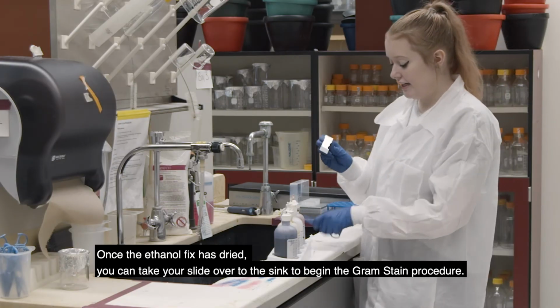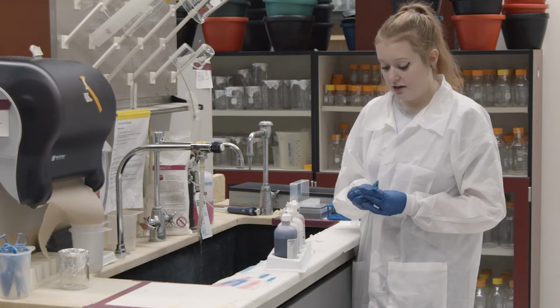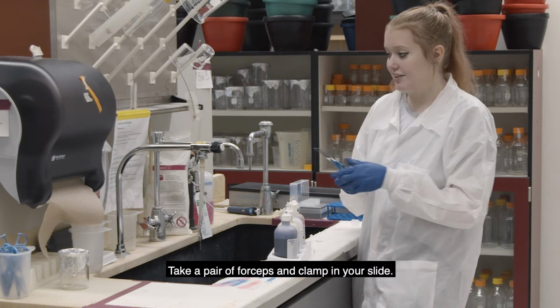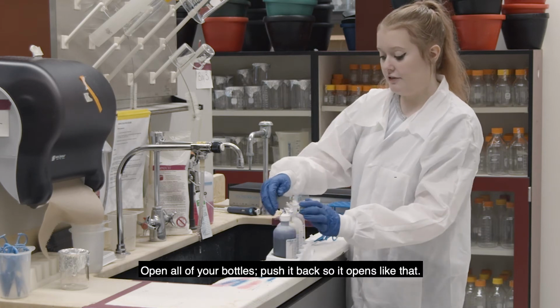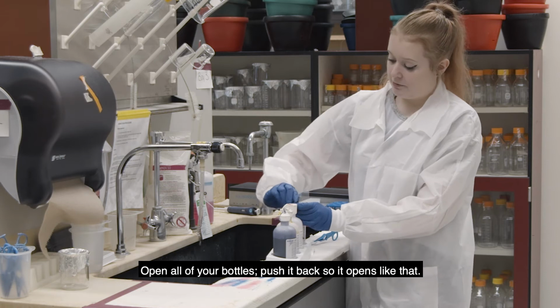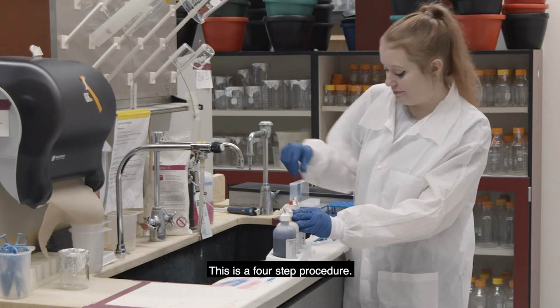You can take your slide over to the sink to begin the gram stain procedure. So you're going to take a pair of forceps and clamp in your slide, and then you're going to begin staining. So you want to open all of your bottles, so just kind of push it back so it's open like that. And this is a 4-step procedure.